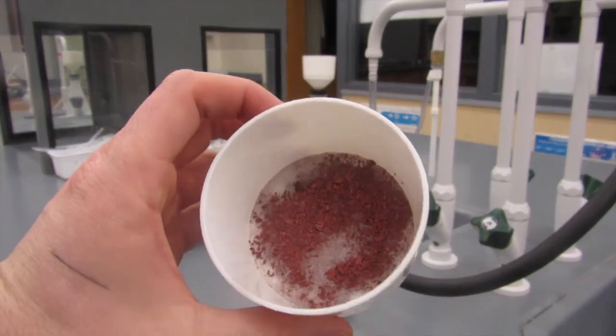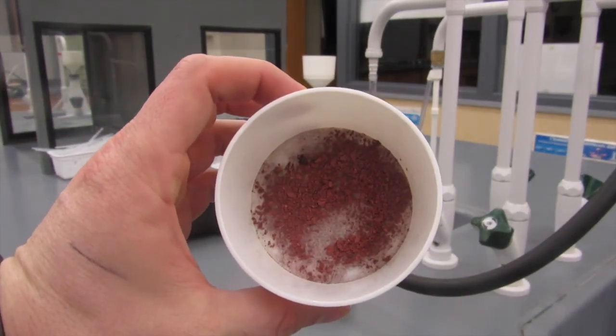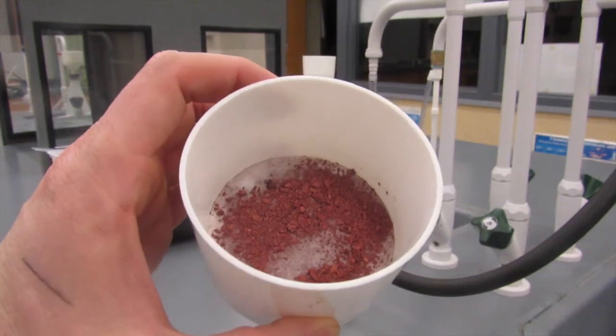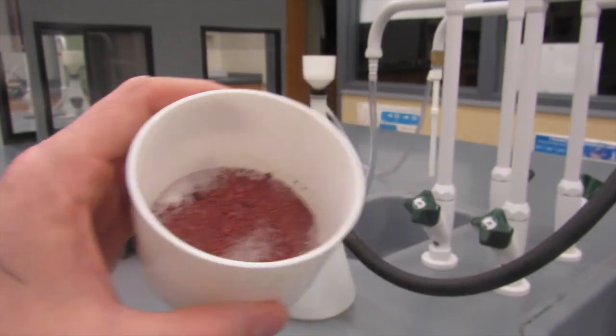Once the reaction is complete, we still have all of our copper in our Buechner funnel, and we're ready to take it out and dry it so we can weigh it when we're all done.